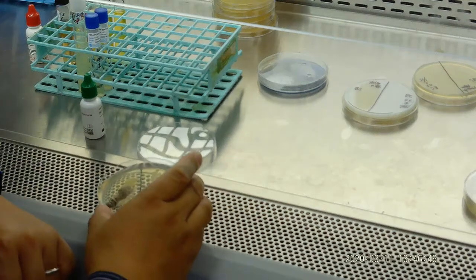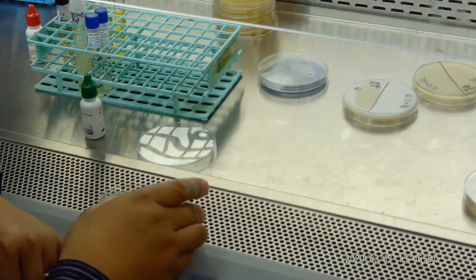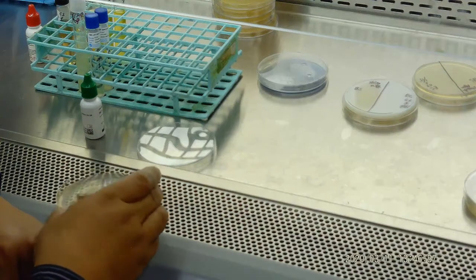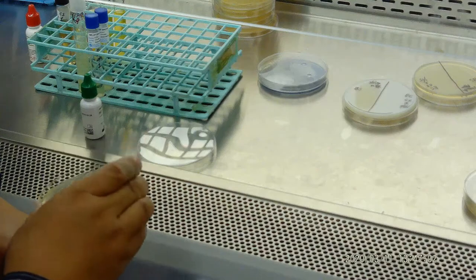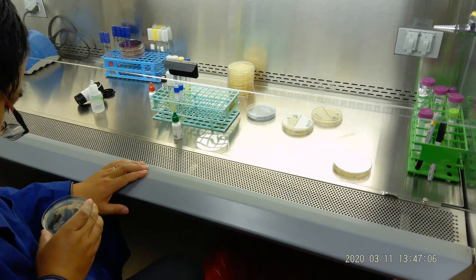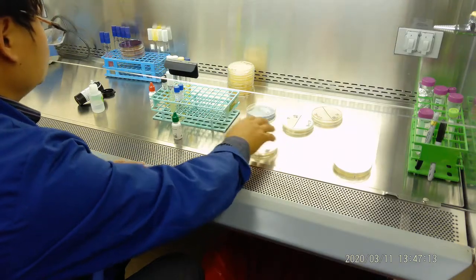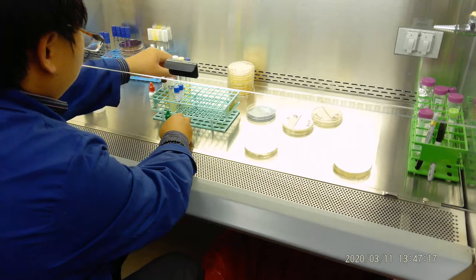Otherwise, it's negative. We need to let it react a little bit. Okay, so here we stop.